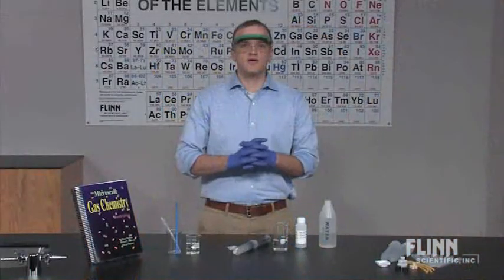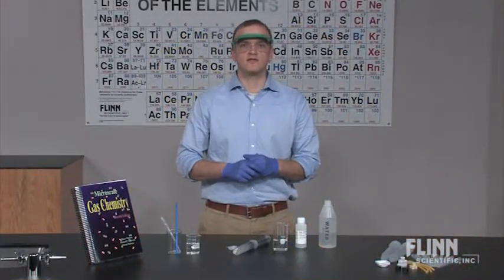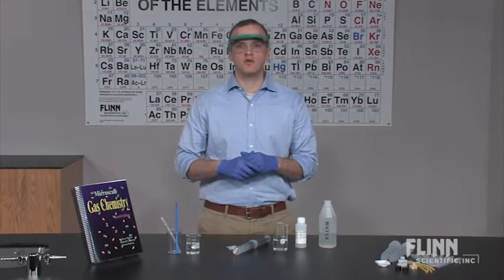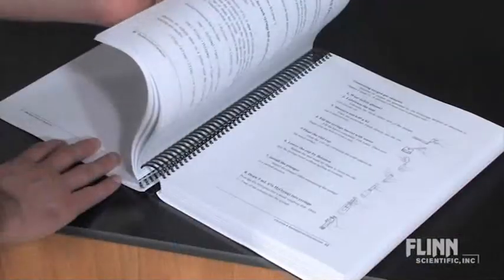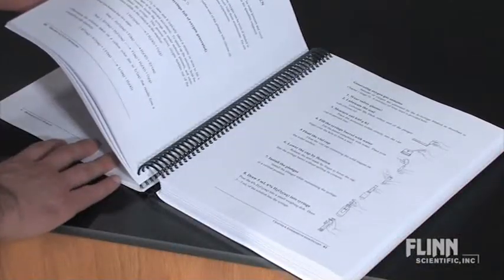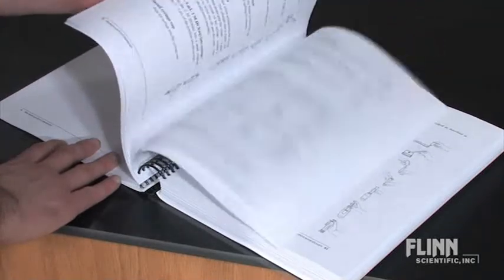Safely generate many other gases in as little as five minutes with little to no chemical waste. The Microscale Gas Chemistry book includes an introduction about the history of gases, as well as a comprehensive index and helpful illustrations to guide you along.